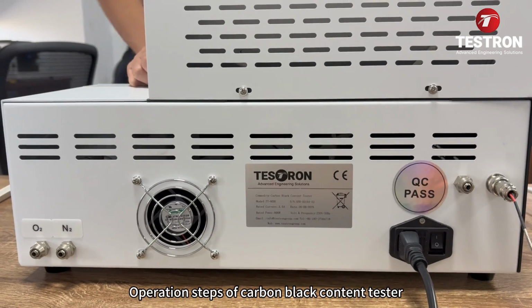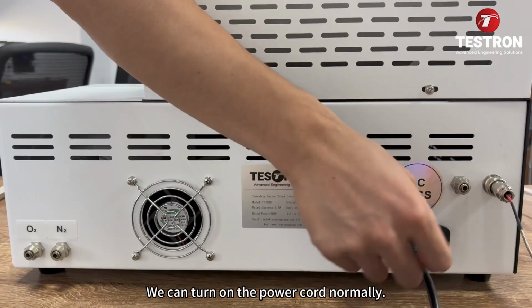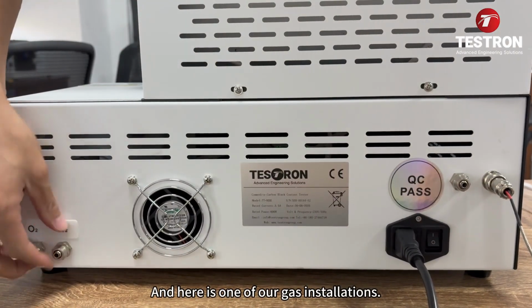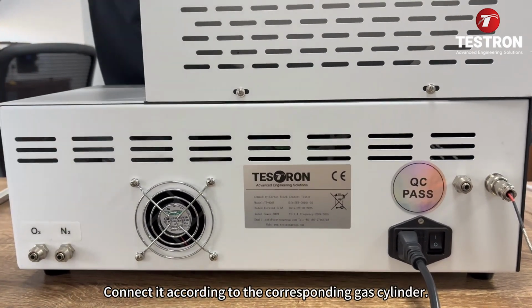Operation steps of the carbon black content tester. First of all, this is our power button. We can turn on the power cord normally. And here is one of our gas installations, connected accordingly to the corresponding gas cylinder.